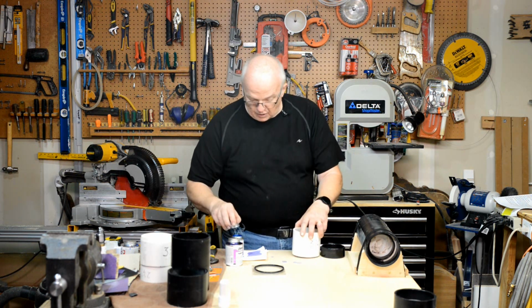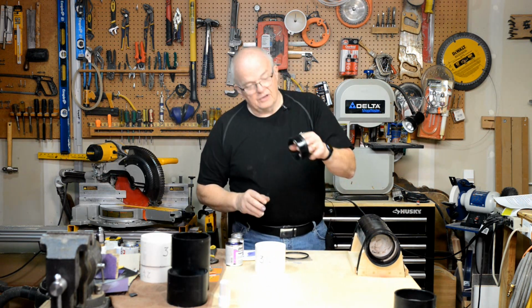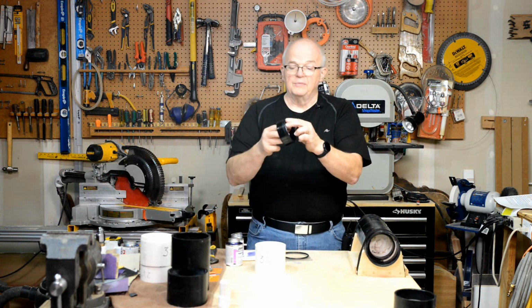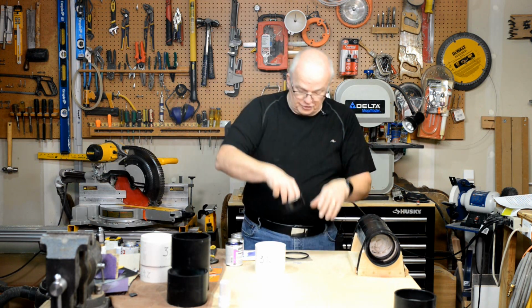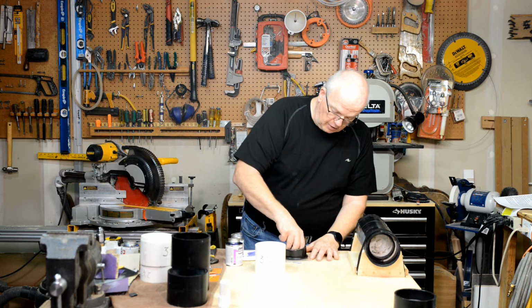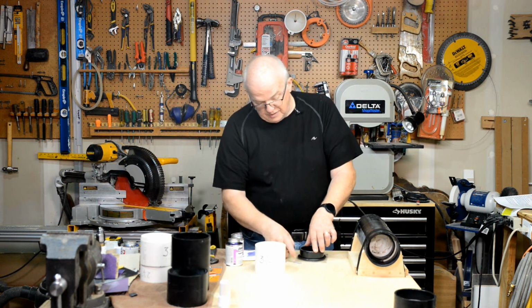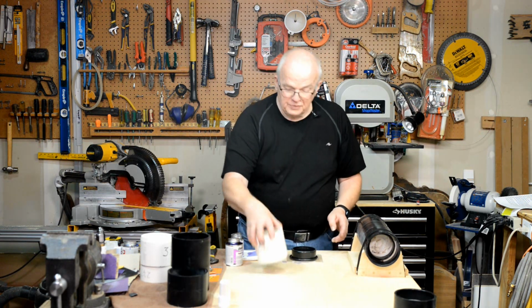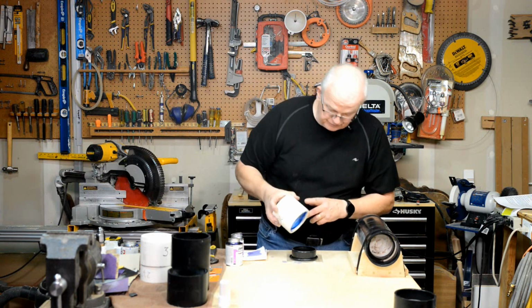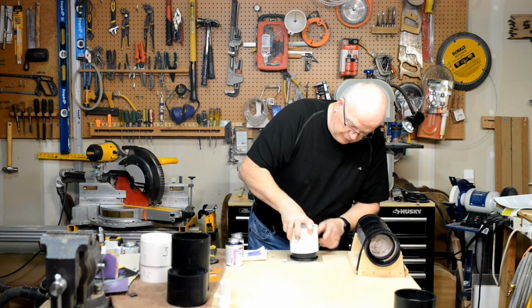All right, now very quickly, this is important to be quick. Take this, it's already been primed. This is the factory edge. This is the edge that you cut. It's going to go up. Put it down in between your O-ring and this PVC. That PVC is acting as a spacer. Then you're going to want to take this, very carefully push it down.